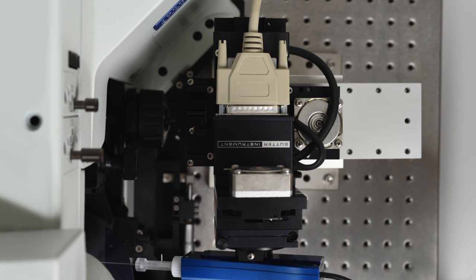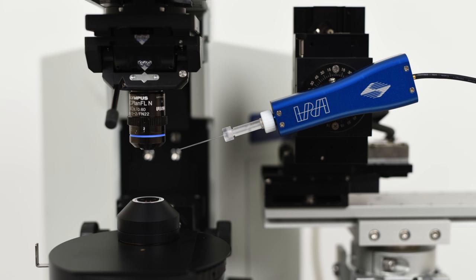It is generally a good practice to make your work position at or near the center of travel for X, Y, and Z to get maximum travel in all directions under the objective.